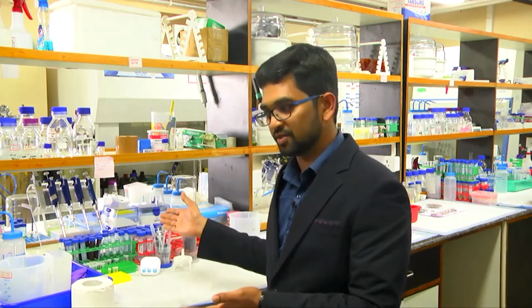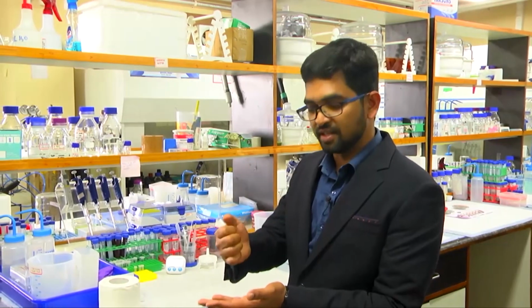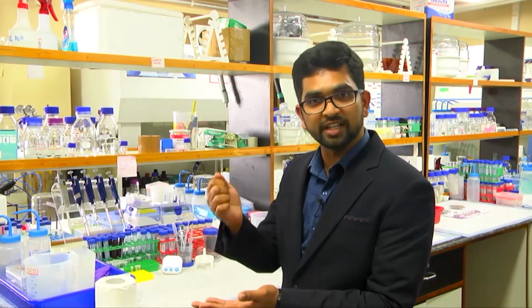So now we are in the lab. Let's develop step by step from the very basic things. Today, I will show you, let's fabricate your sensor, how we will start from the biological molecules, how we will synthesize all the nanoparticles, and let's use them for diagnosis. So this is the right time for you today.